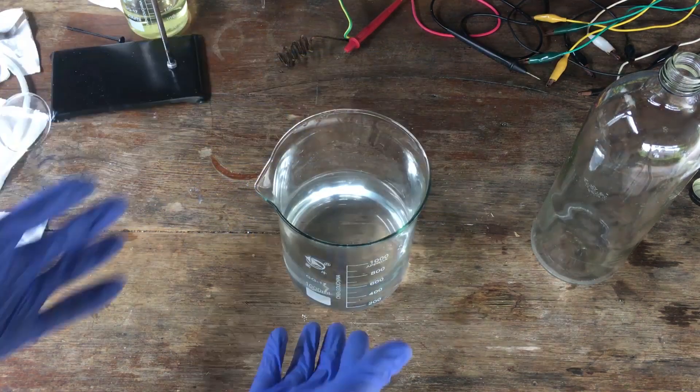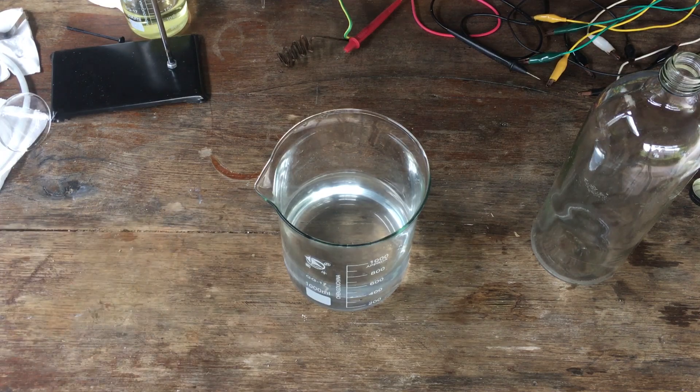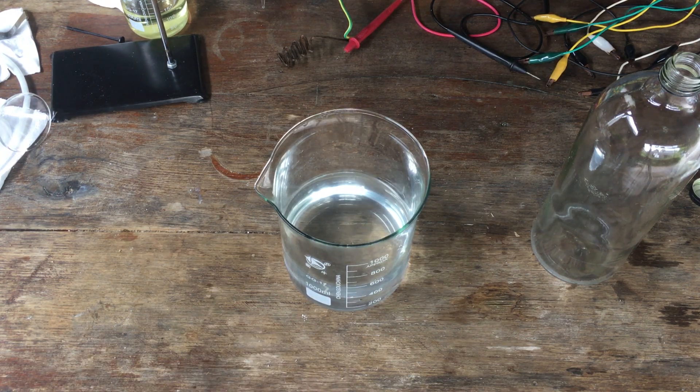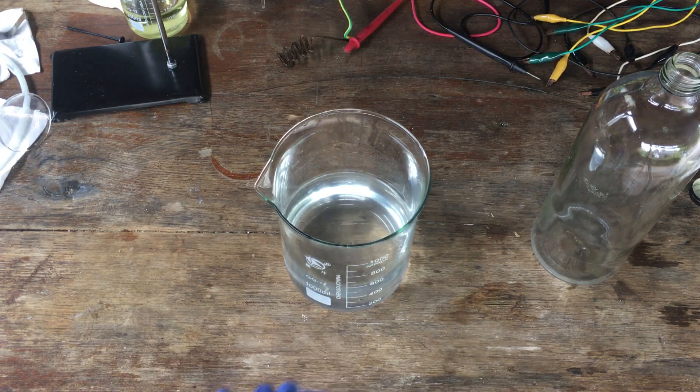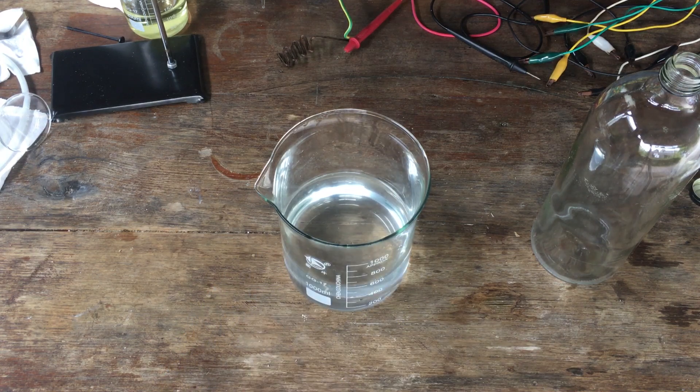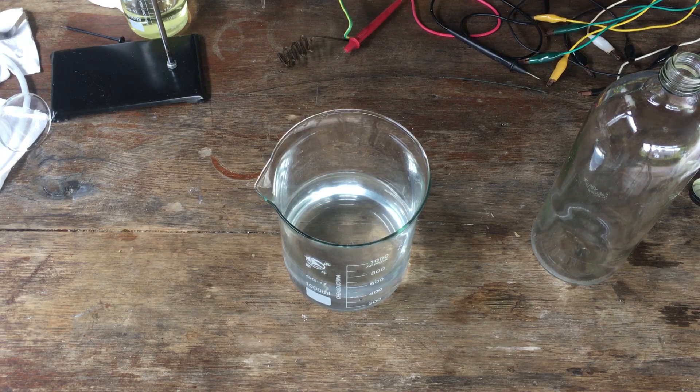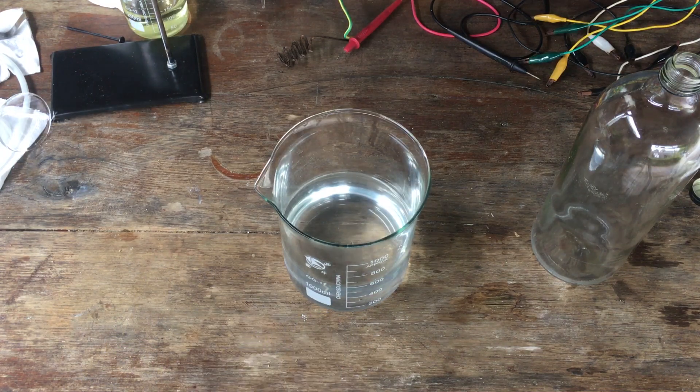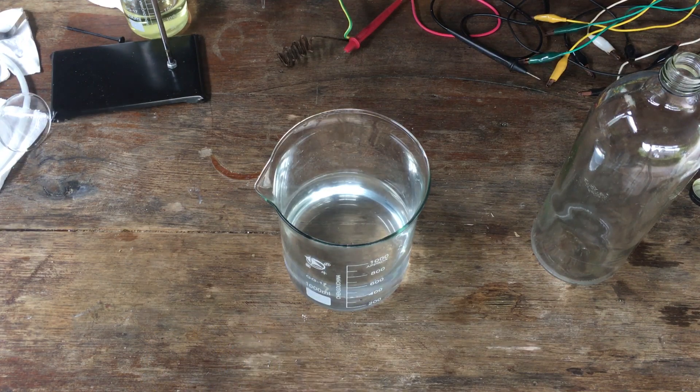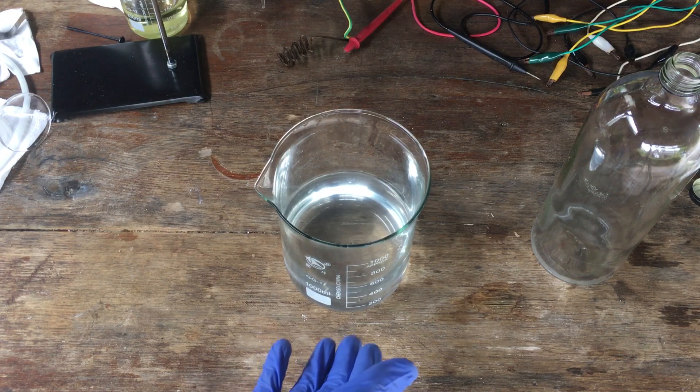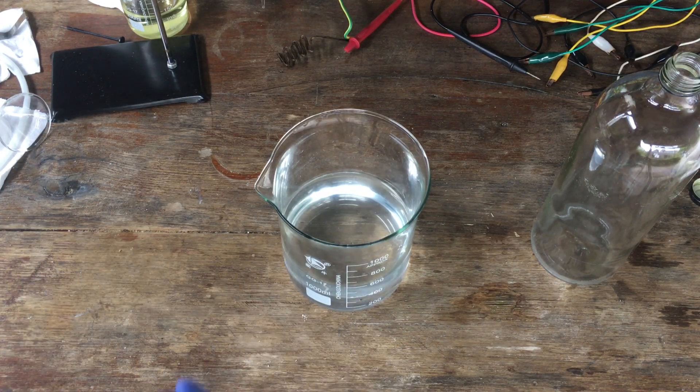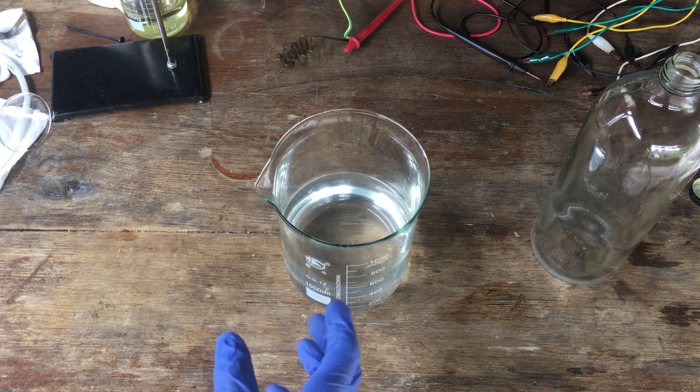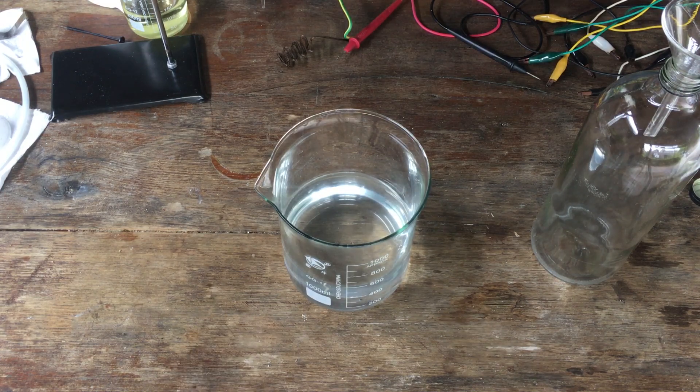As it turns out, in our solution of 600 millilitres here, there is close to 50 or 60 grams worth of potassium hydroxide there, which is crazy. I had to double check my titration. I did a second and a third one to check that the results were correct. But, yep, around about 55 grams worth of potassium hydroxide in solution here, which is, yeah, a lot more than I was expecting, especially considering we've done this process for sodium hydroxide before, where the efficiency was around 15%, and in this case, the efficiency was around 25 to 30%, which, like I know, we just did an experiment showing that the efficiency of the potassium hydroxide process is way better than the sodium hydroxide process, but I wasn't expecting a change that big for our chloroalkali cell. But I can't complain. A better yield than we expected is always a good thing.